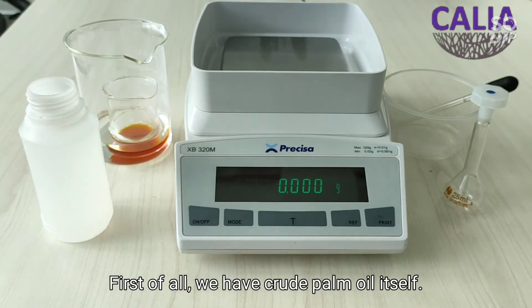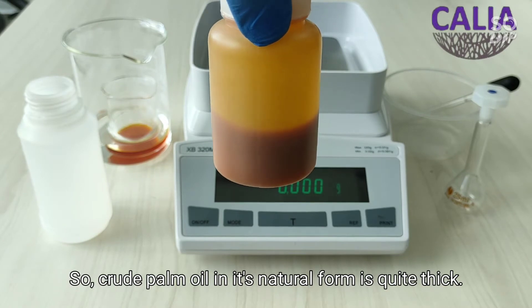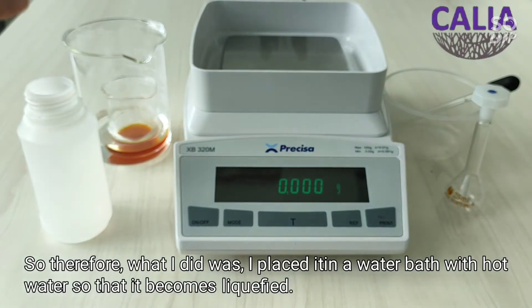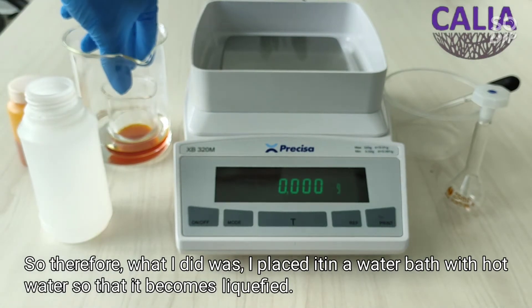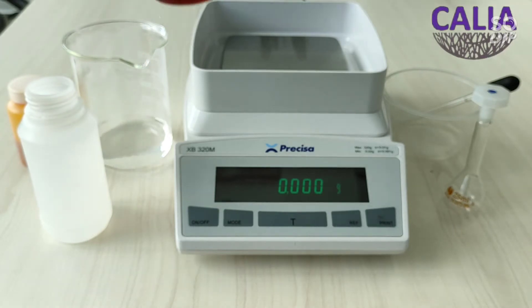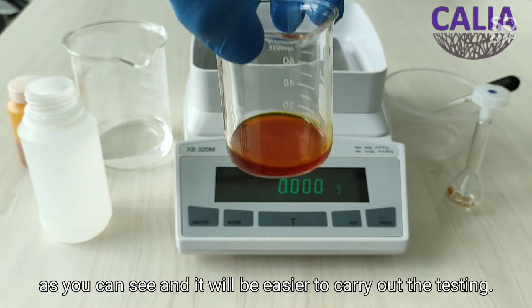First of all we have crude palm oil itself. Crude palm oil in its natural form is quite thick, so therefore what I did was I placed it in a water bath with hot water so that it becomes liquefied, as you can see, and it will be easier to carry out the test.